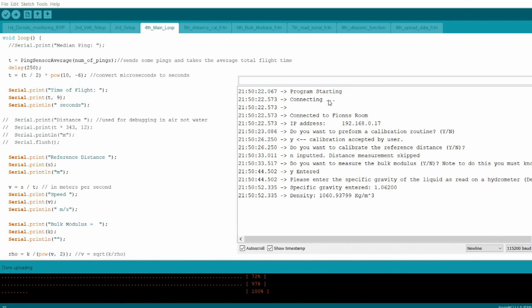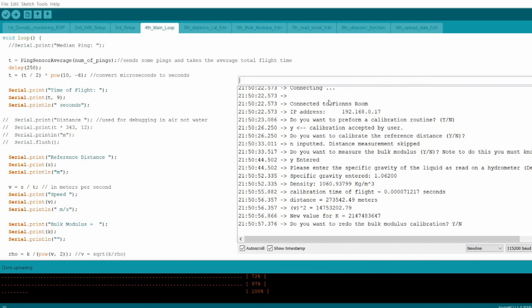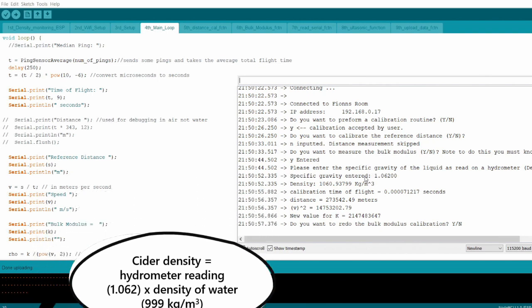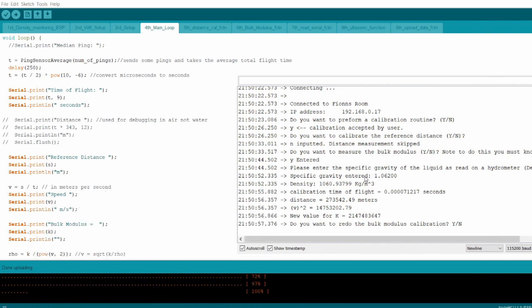So now that we've entered this, it gives us the equivalent density, and it gives us the calibration findings. So there's a mistake here. If you can find that, I'll go into it a bit later on, but see if you can spot it here. But the K, which is the bulk modulus, is about on par for what standard liquids are.